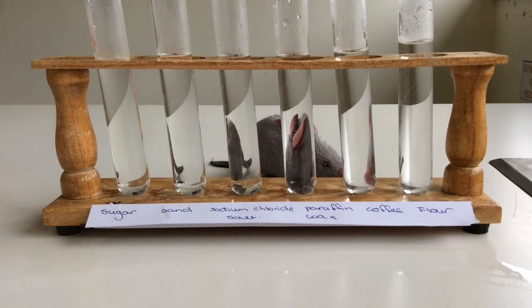These substances that you can see in front of you, you can actually probably find all of these in your home. So if your parents were okay, you could probably try out this part of the experiment yourself. All you would need is a couple of glasses of water and the different substances, even if you just tried a couple of them. Alrighty, let's go.